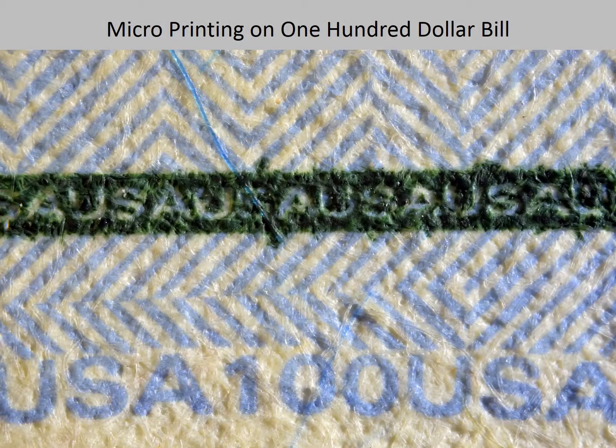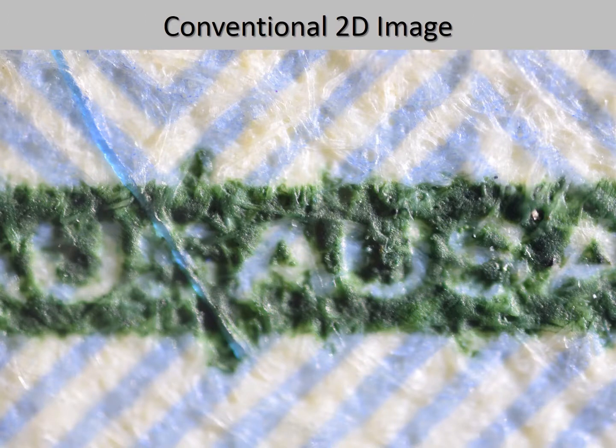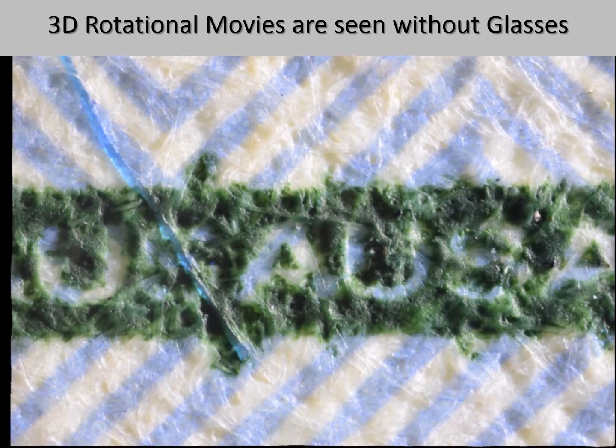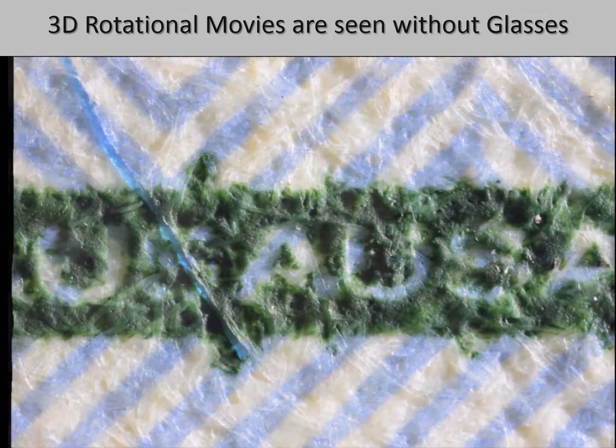This is a picture of the microprinting on the end of a $100 bill that says USA, USA, USA. We can see a blue security fiber on the top portion of the image. Here is a closer two-dimensional view of the microprinting, and we see that only a portion of the image is in focus. This 3D video loop of the microprinting shows the three-dimensional nature of the microprinting. And here is a closer view of the 3D printing.